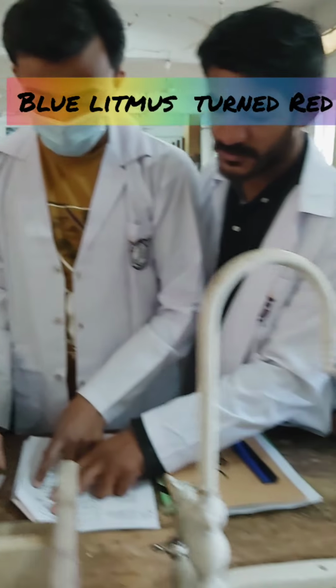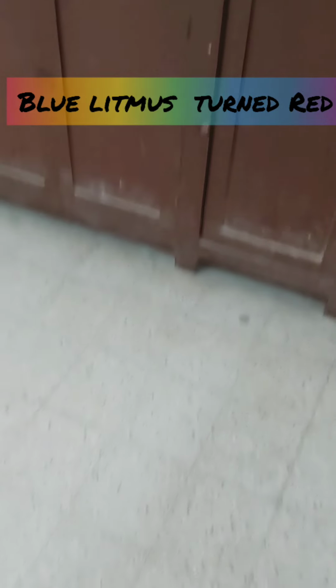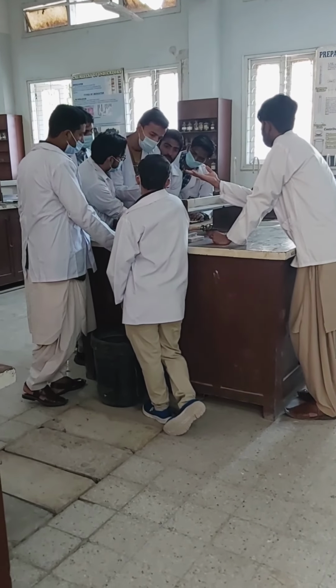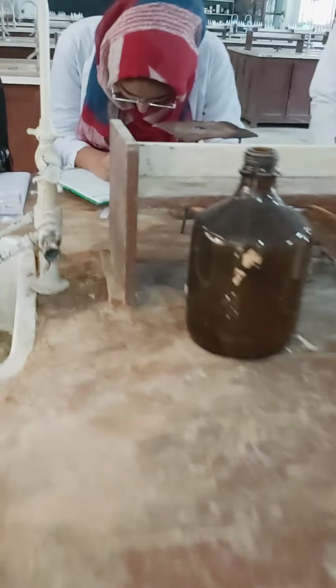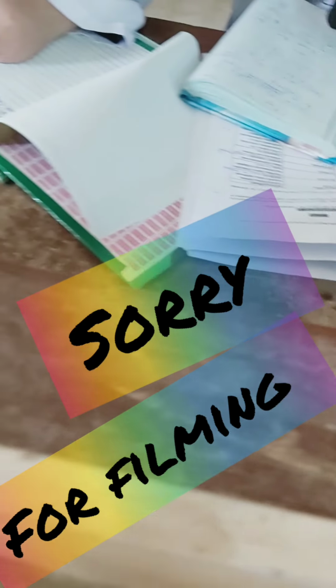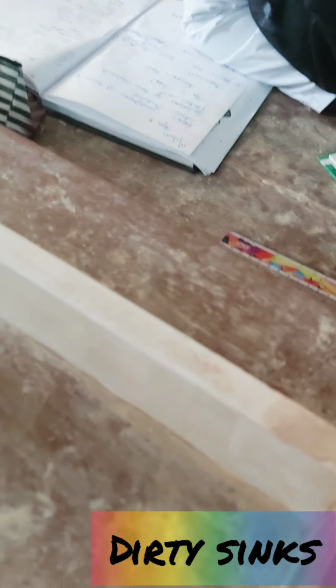Very good. Students are divided into two groups, the girls and the boys. This is the girls' side and that is the boys' side. They are still performing, but the girls have performed and now they are writing in their journals. This is very good. They are writing the new journal, the very first experiment, with the help of their schemes and the results which they got. They are going to put the results into their columns.